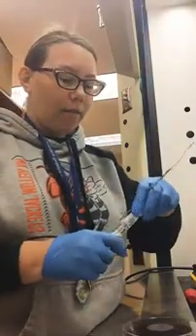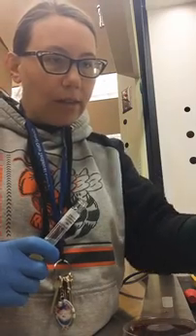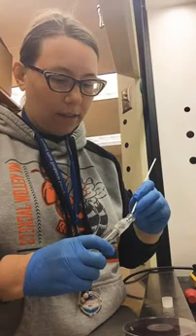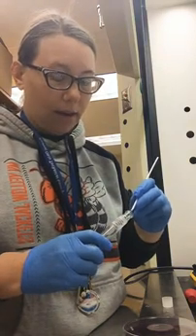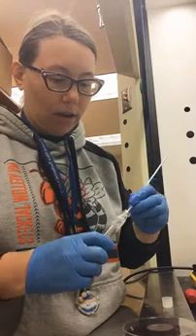You are going to have blood agar as an option for your unknown 3. It'll be one of the tests you can do to help you support your gram stain identification. So this is another good one to just take notes. Make sure you keep everything straight so that you can reference it when you get to your unknown, if you choose to do another blood agar.